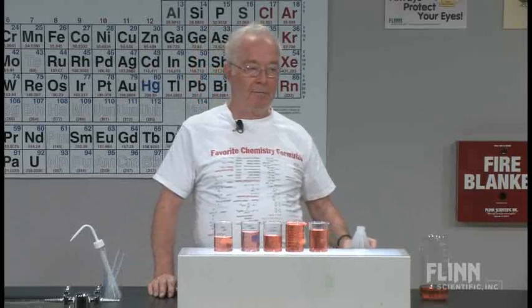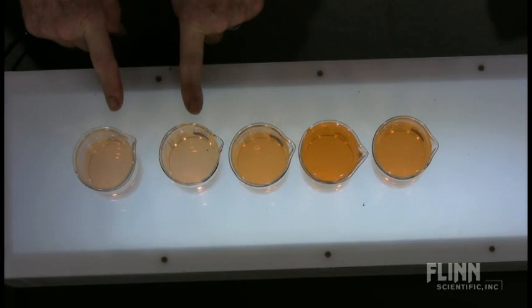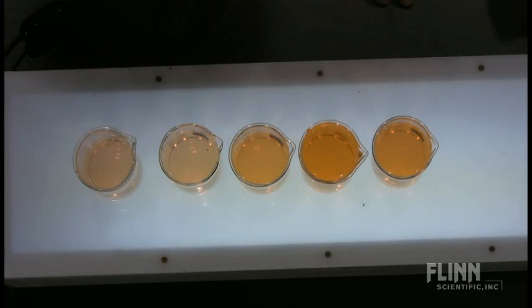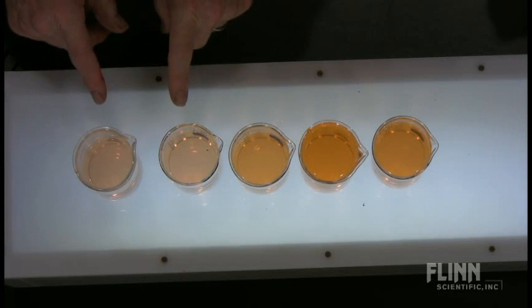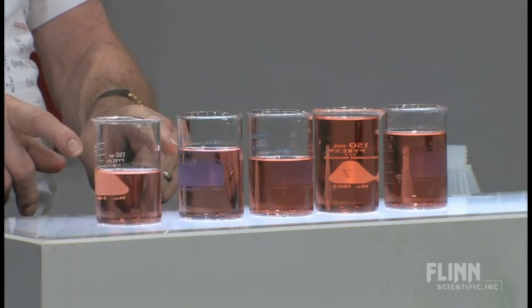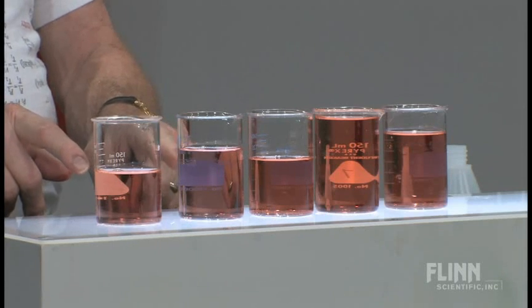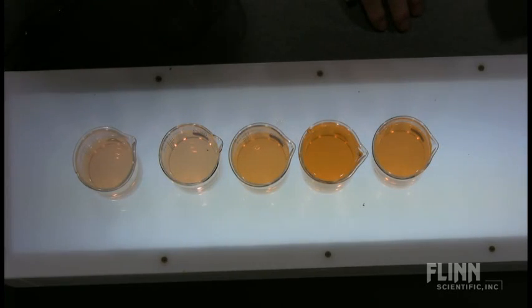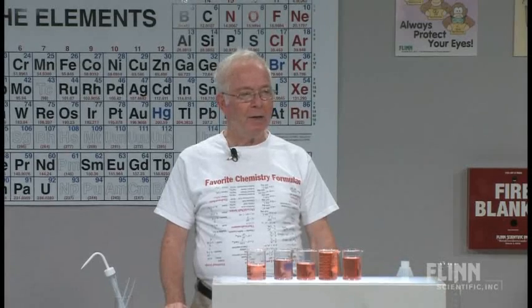Now let's look vertically. I want you to look at the color of the liquid in these two beakers. We know, from what you've just told me, that looking at them horizontally through the beakers, the colors are different. Now looking vertically through the colors, they're the same. How can that be?